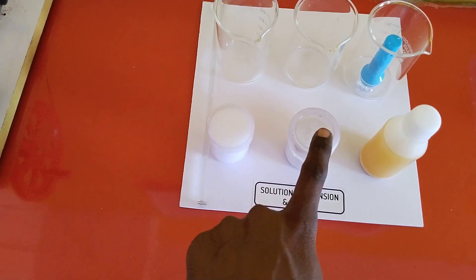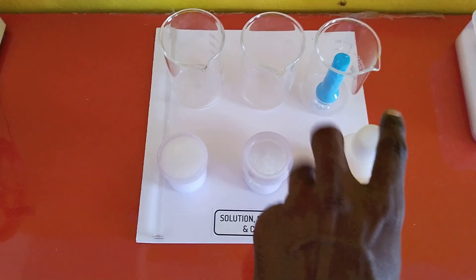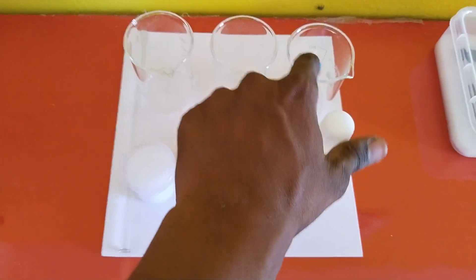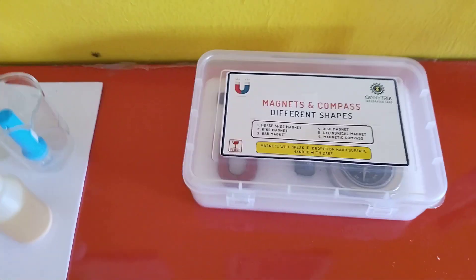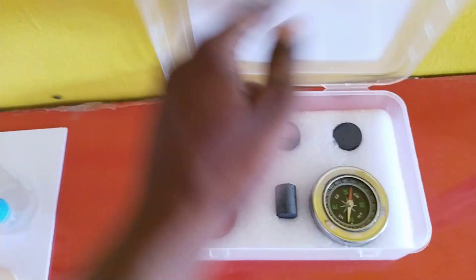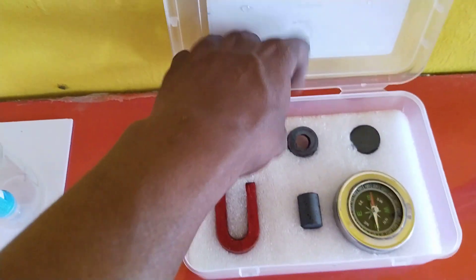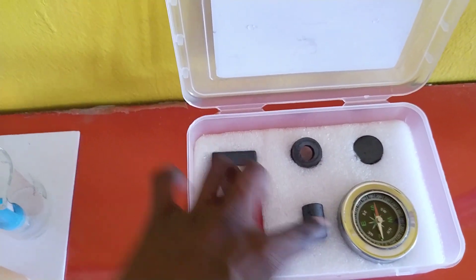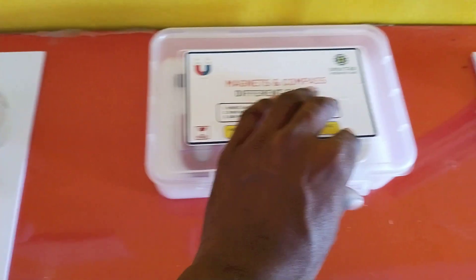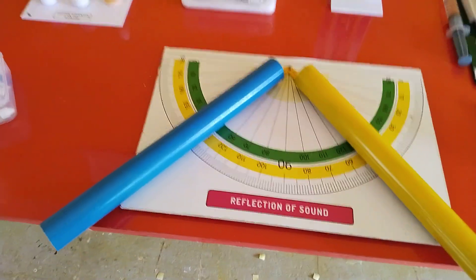This demonstrates solutions, suspensions, and colloids. Salt solution, powder or flour suspension, and a colloidal solution — with an LED we can see the Tyndall effect. We have magnets and compass in different shapes: horseshoe magnet, bar magnet, ring magnet, disc magnet, cylindrical magnet, and compass. All these sets come in a single pack.